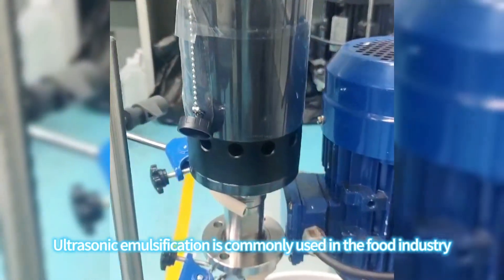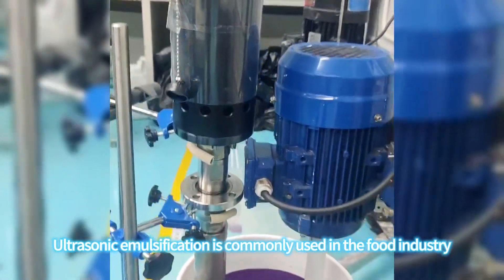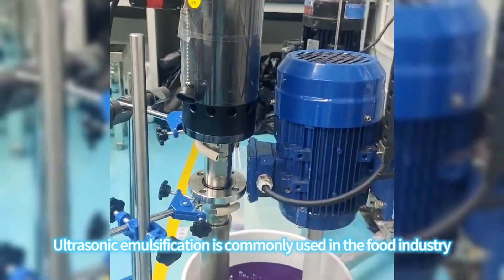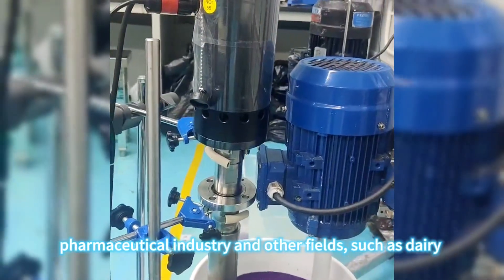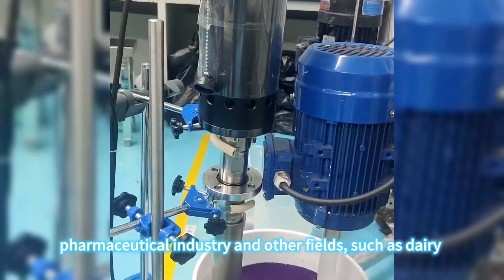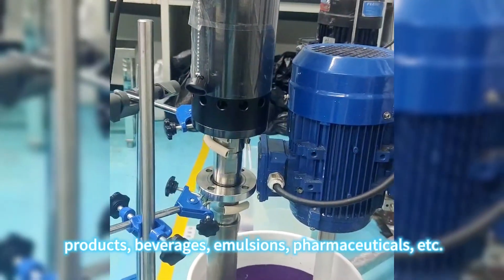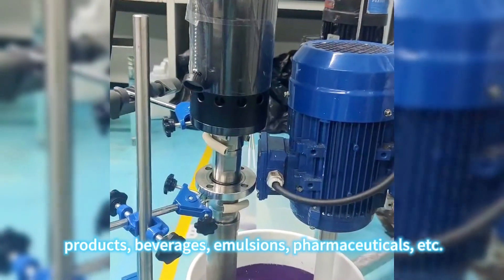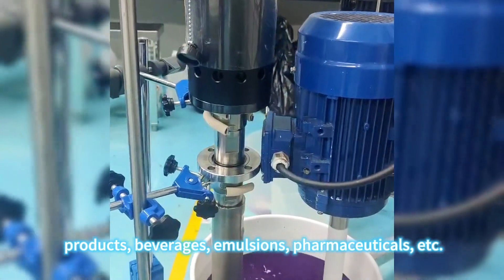Ultrasonic emulsification is commonly used in the food industry, pharmaceutical industry and other fields, such as dairy products, beverages, emulsions, pharmaceuticals, etc.